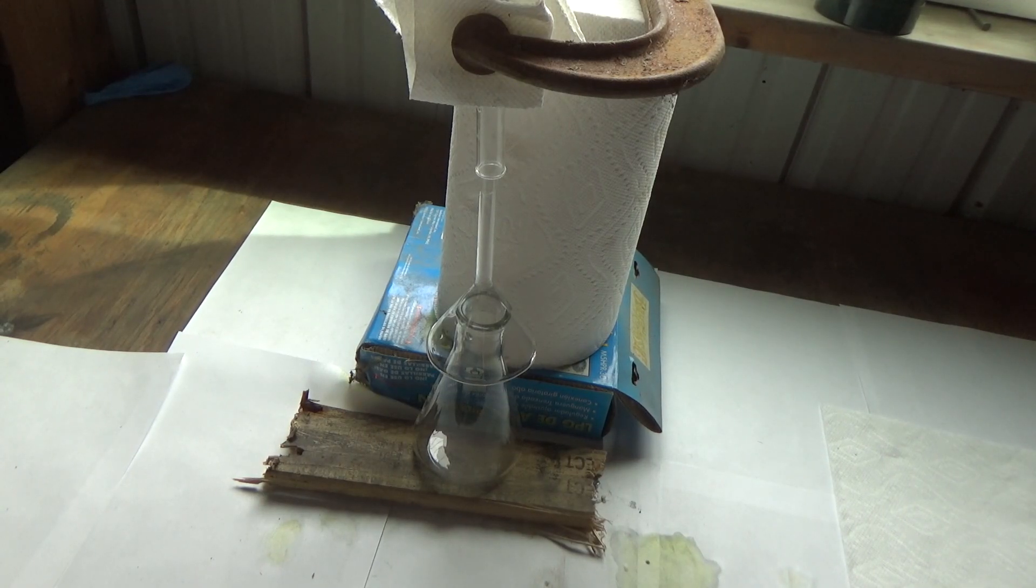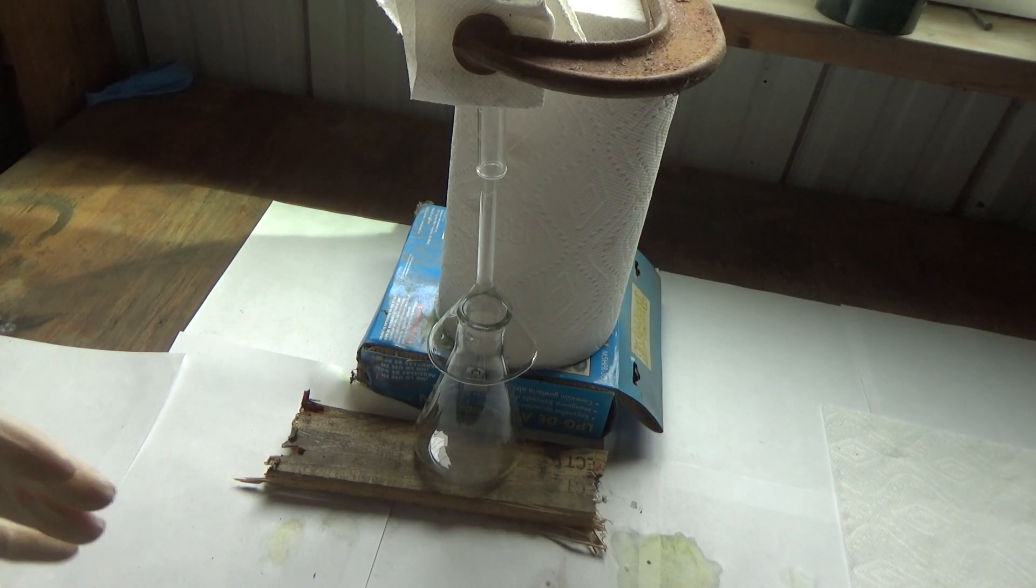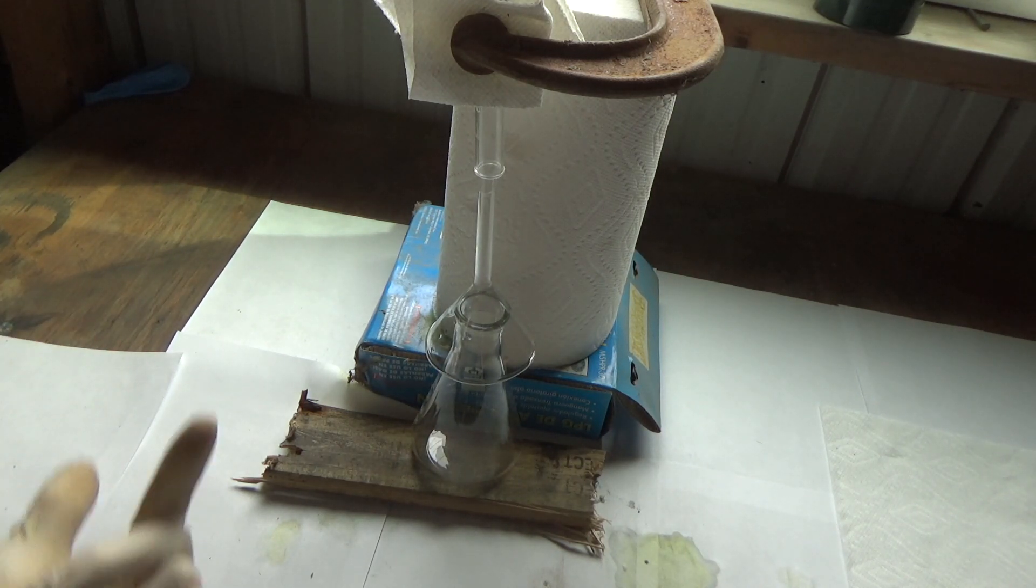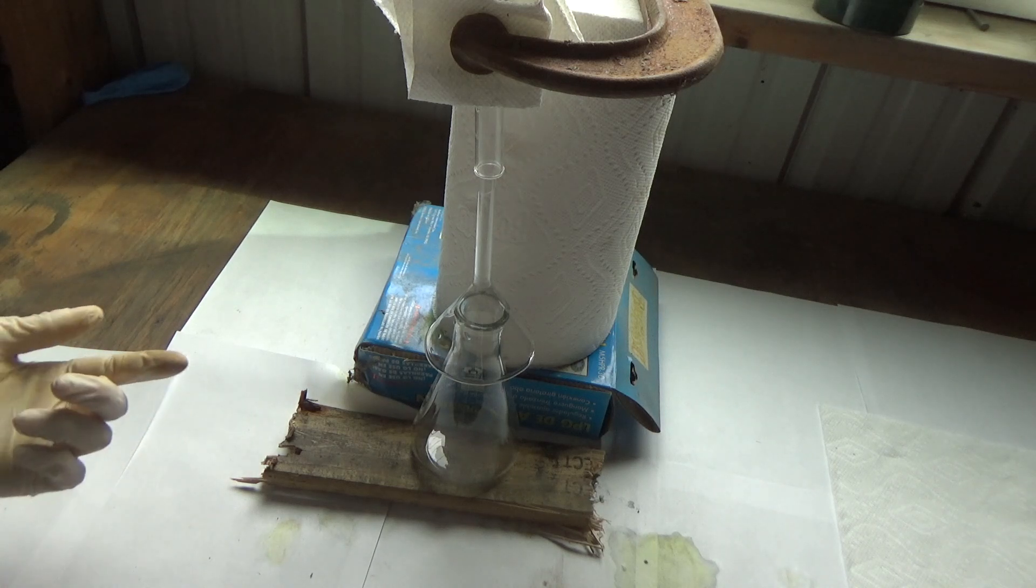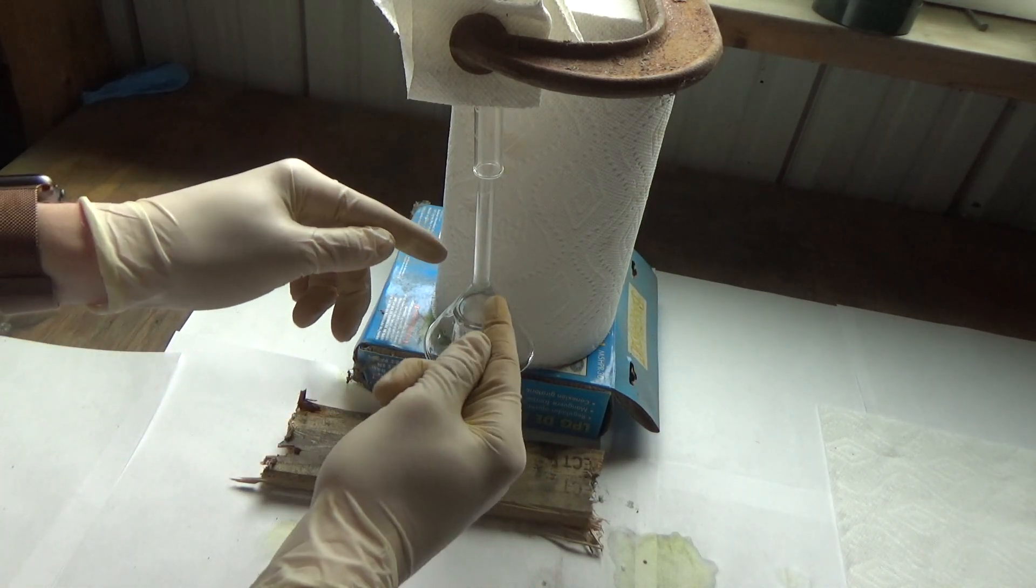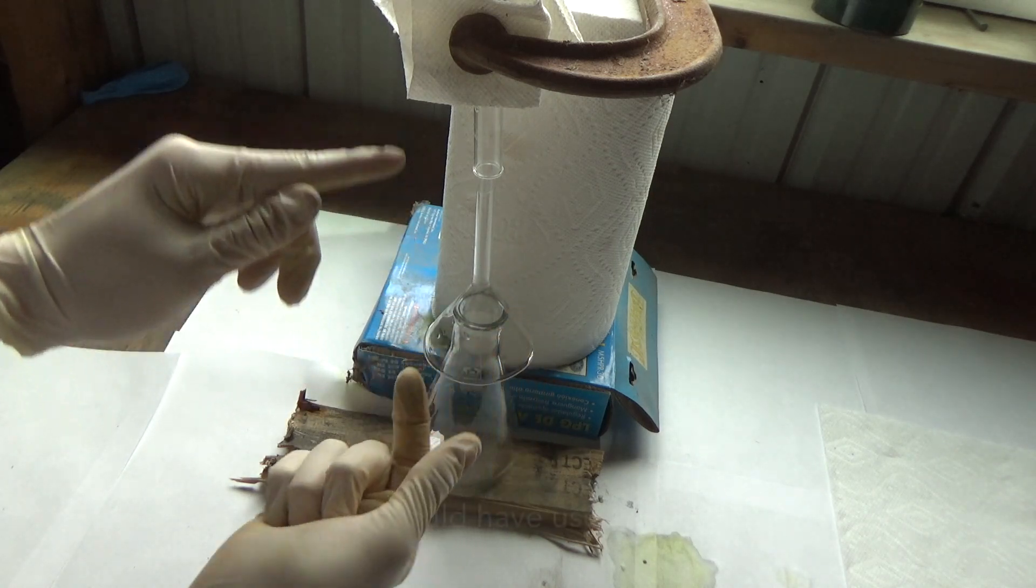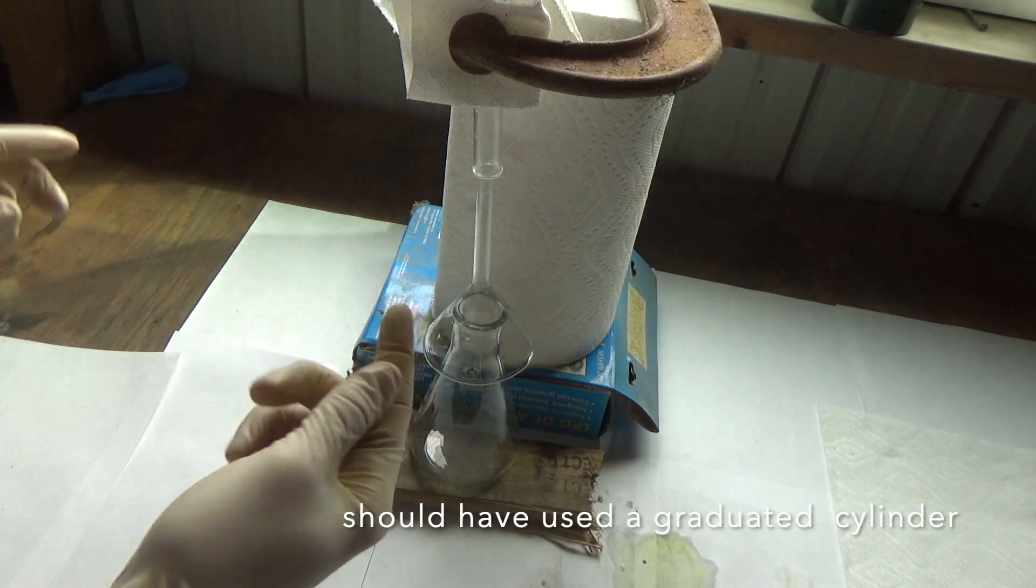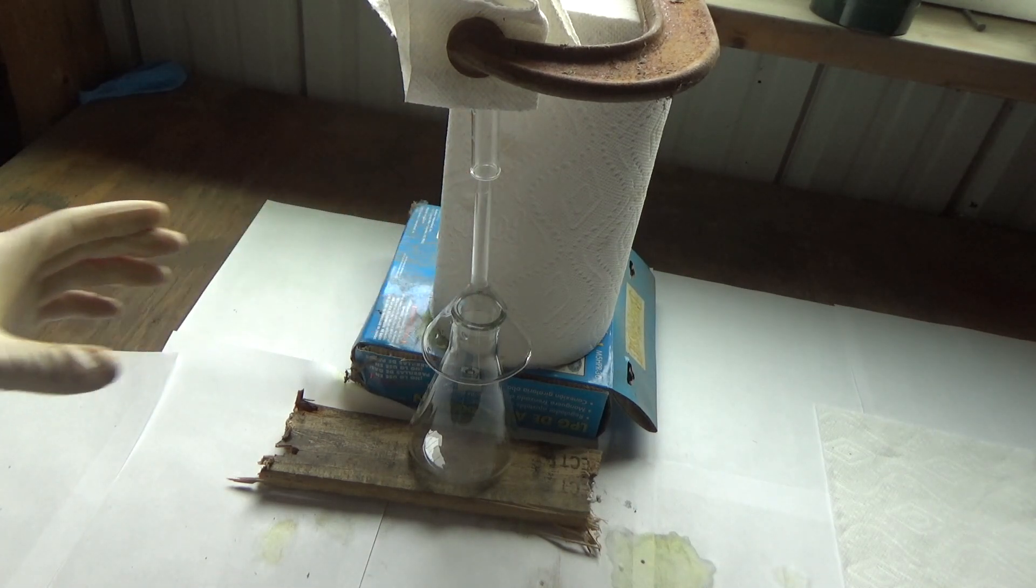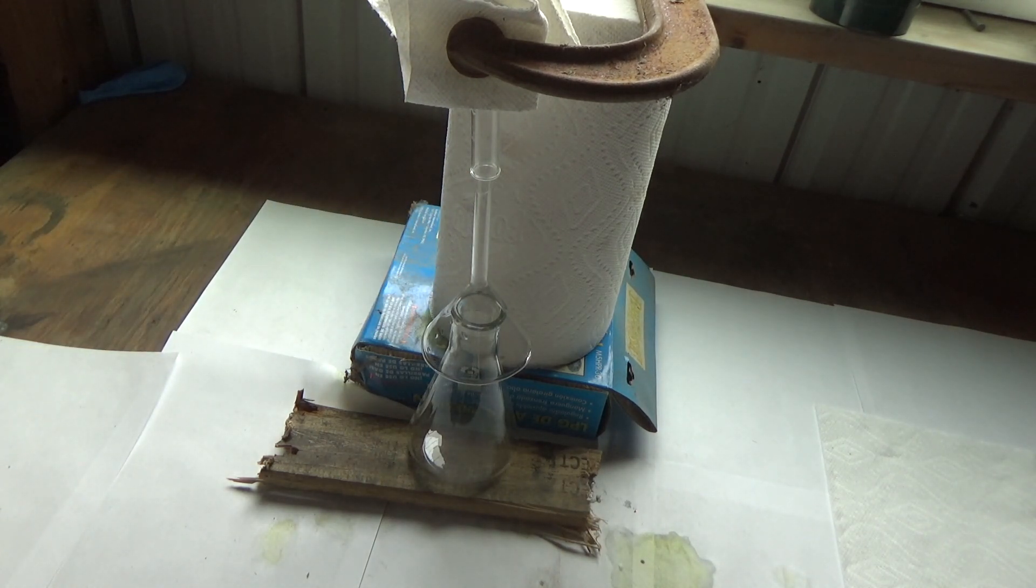So I thought of a new way to sort of show that hydrogen is actually being produced. So hydrogen is lighter than normal air. So it's going to go up, obviously. So if I get a little flask or a beaker or something and then put this little funnel on it, and put it up into this test tube, hopefully hydrogen will collect in that little test tube. But who knows, honestly.